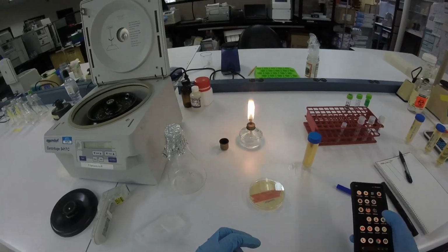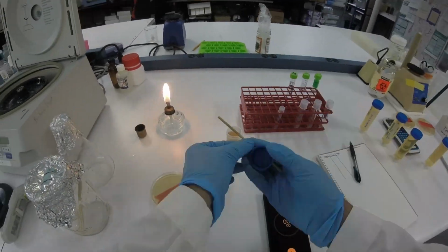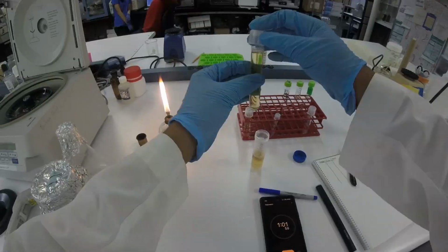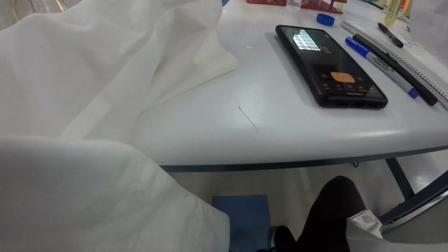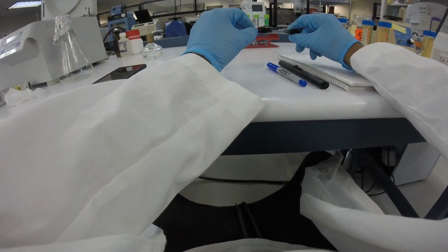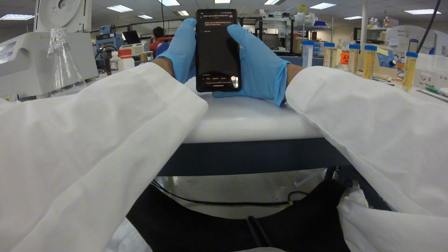And I think this could also have been a source of error, because of possible contamination, which honestly I don't think there was, because I autoclaved the LB. But the thing is, it was sitting out exposed to the air, so something could have landed on it and started to grow. And there is some evidence that this may have happened in the plot. Let me put the plot up again.